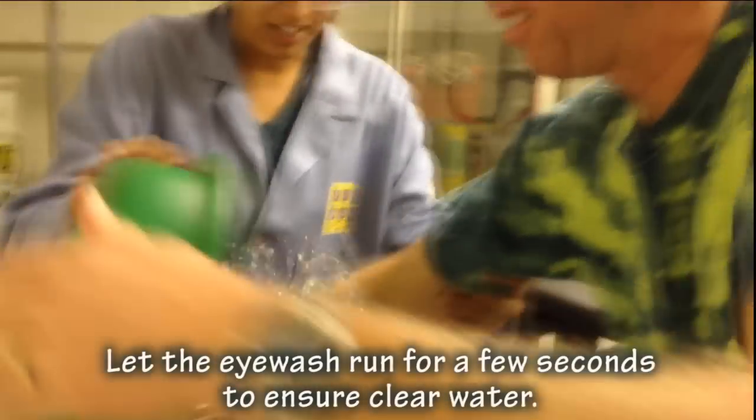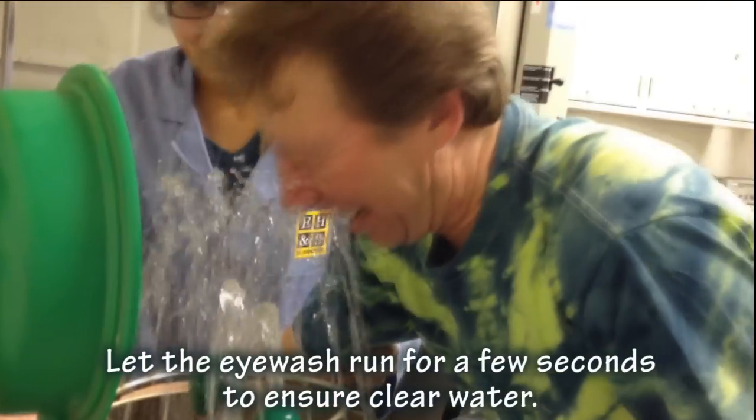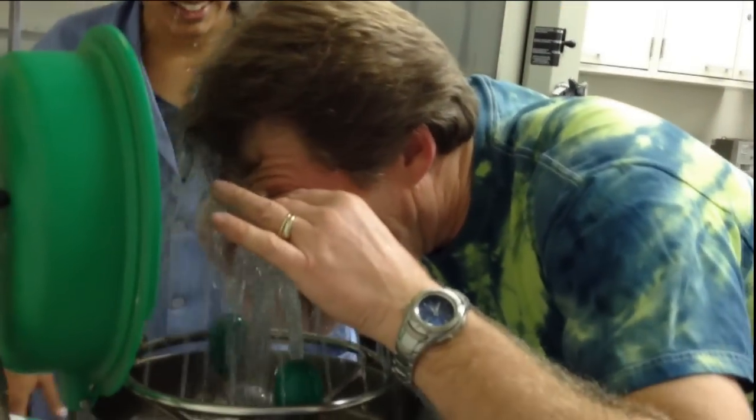Alright, put your head in there. Ahhhh! Help! Keep going! Keep your eyes in there!